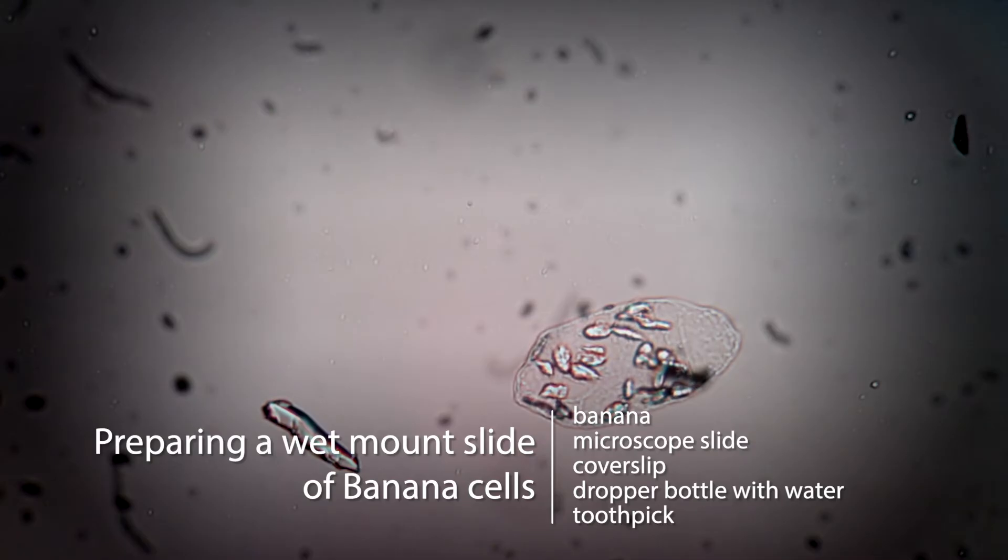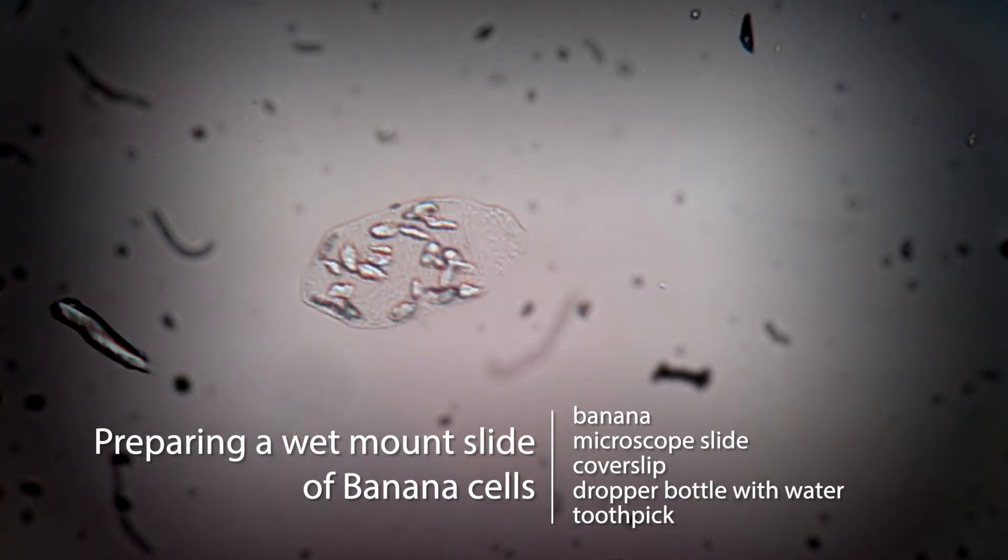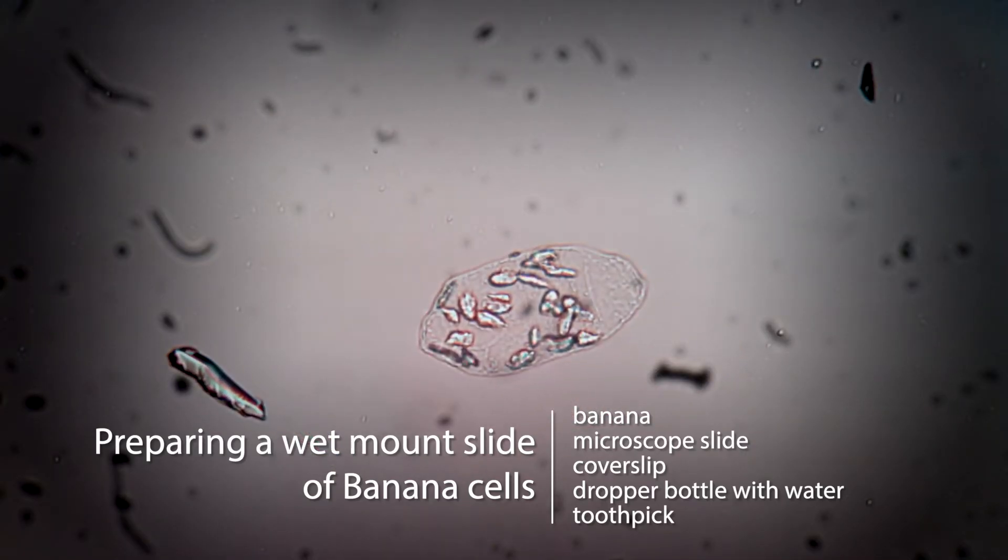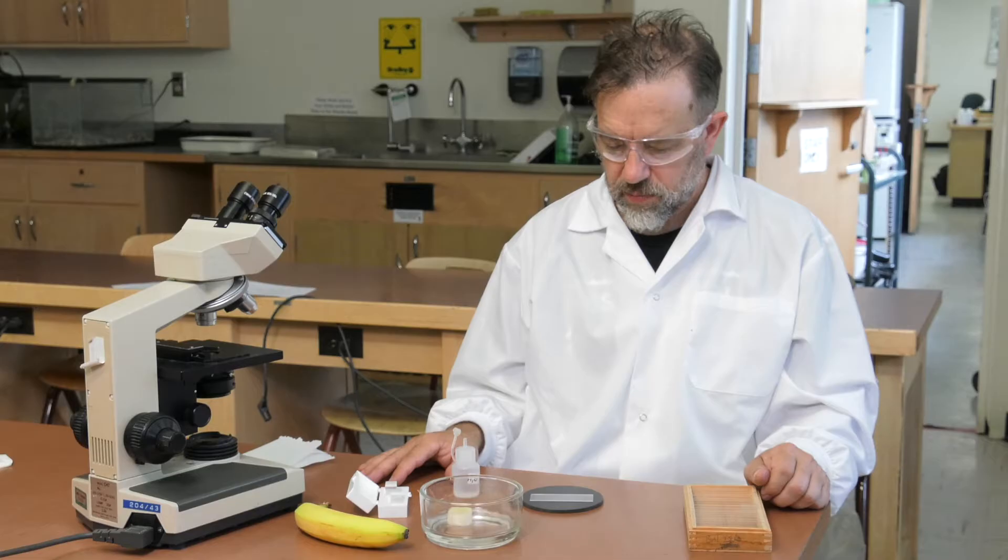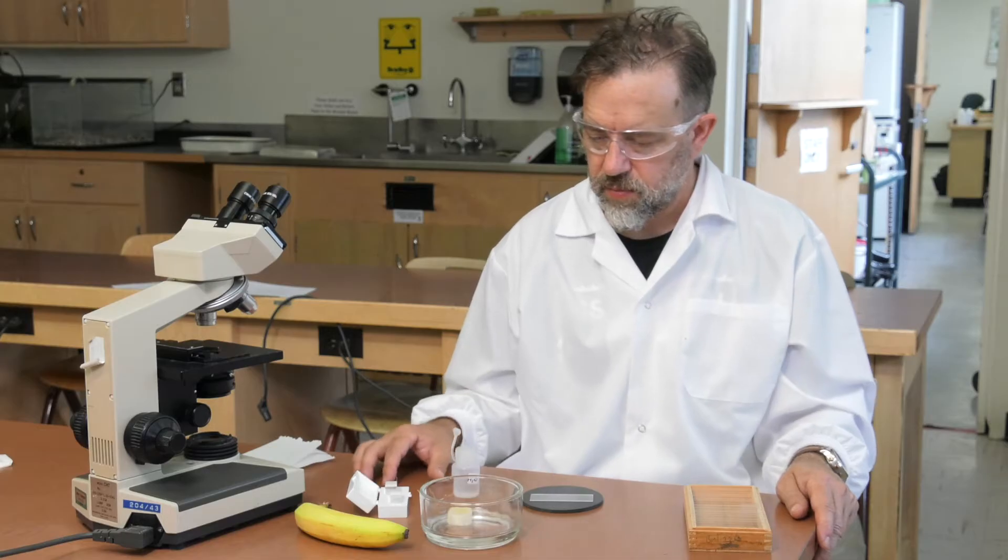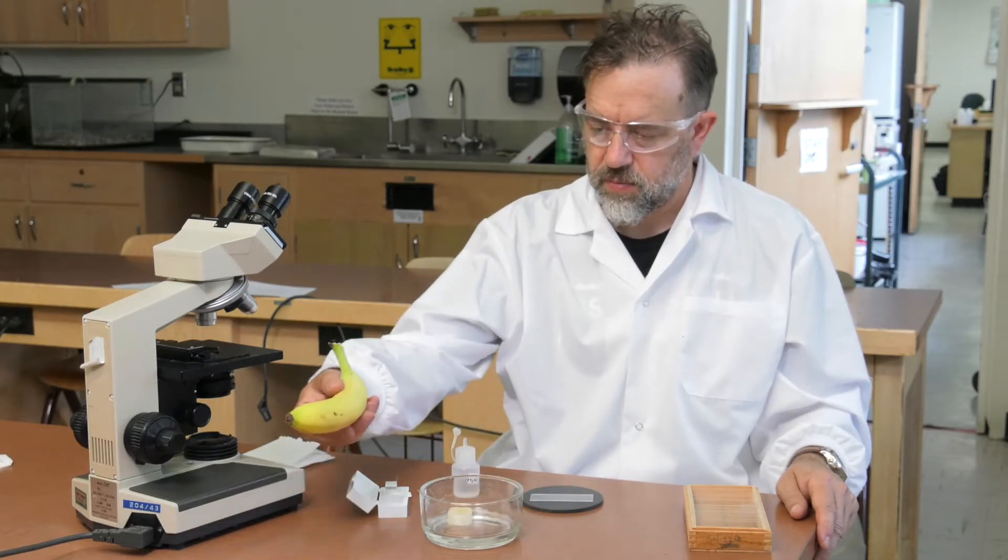Hello and welcome to the tutorial video for preparing a wet mount slide of banana cells. In addition to slides and cover slips, you will need a toothpick and banana provided at the side bench.